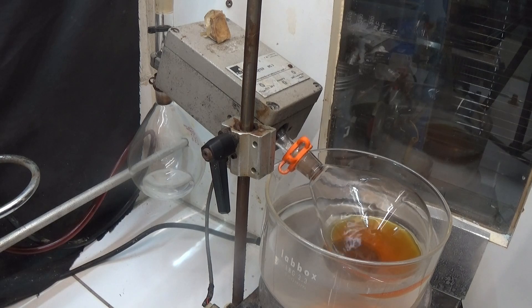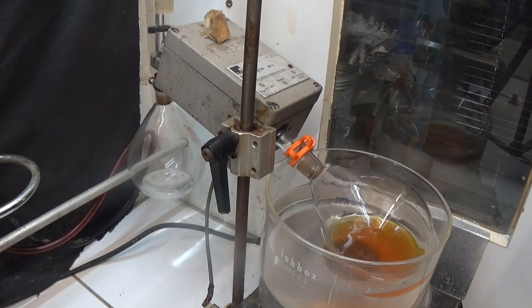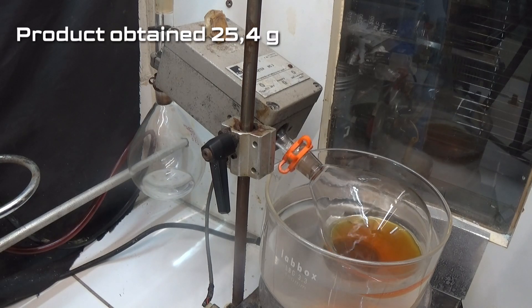Eliminate the ether by distillation in a water bath. Weight of the product obtained: 25 grams.